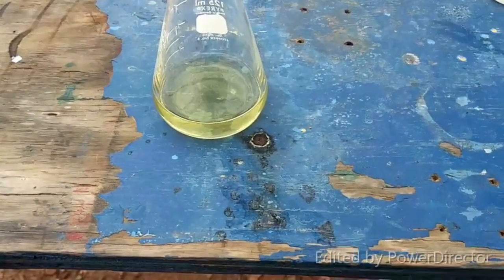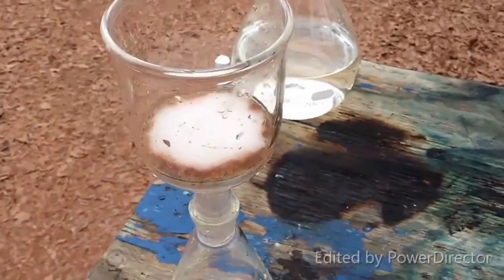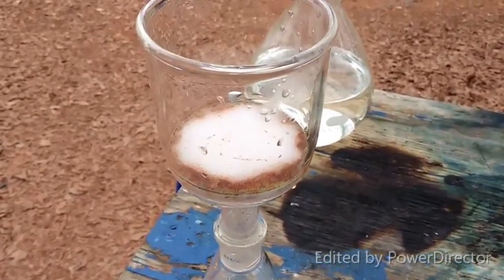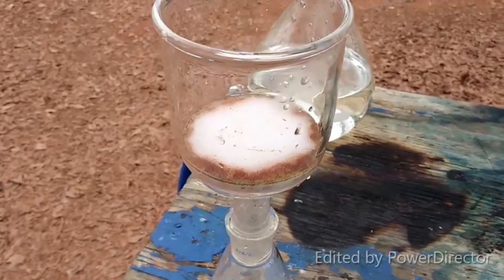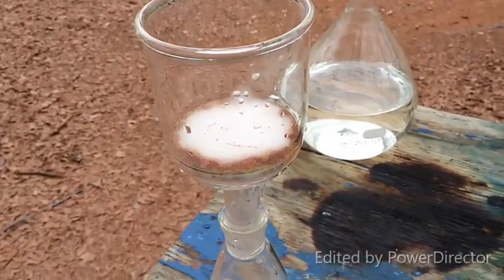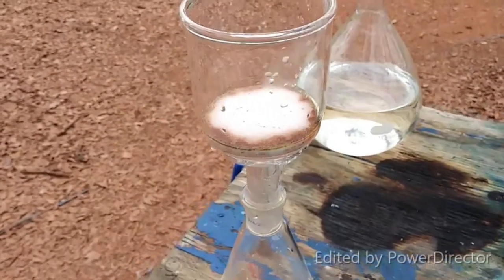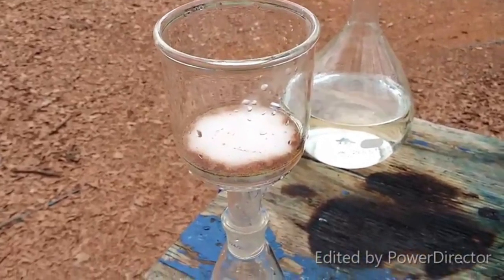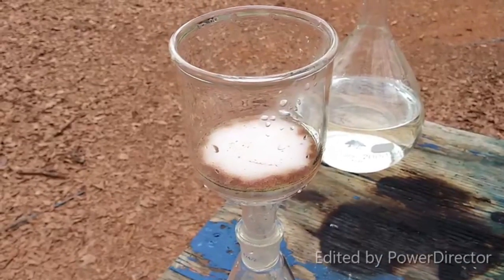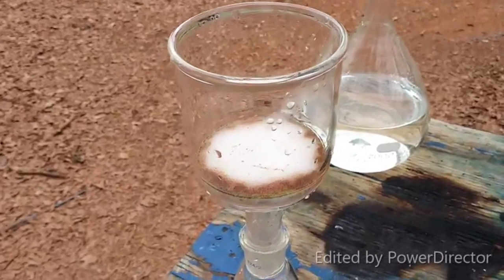If anybody else unwisely attempts this experiment, I said, man, it about destroyed my funnel. The way that I cleaned this up, because I was very nervous about adding acid to a cyanide to clean it up, is I added sodium hypochlorite, a 10% solution, and that converted, according to the textbook, alkaline oxidants will convert it to hydrated nickel oxide, which seemed to be exactly what happened. It turned it into a black mess.